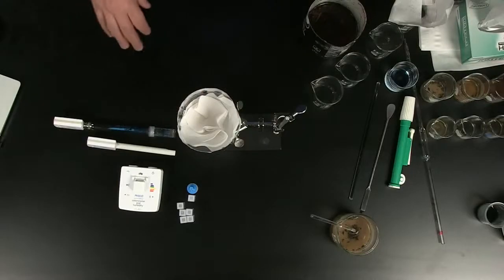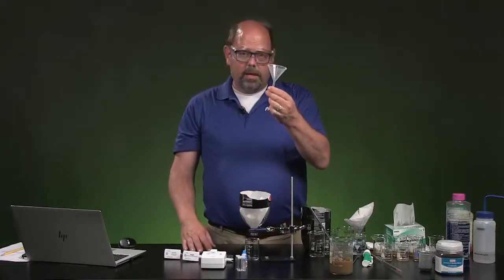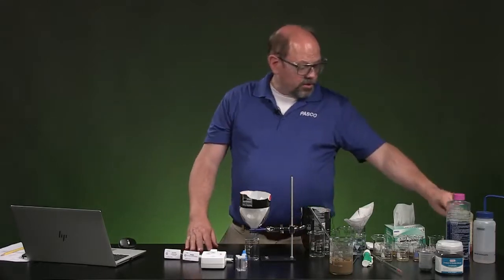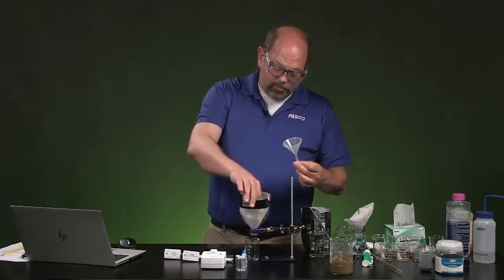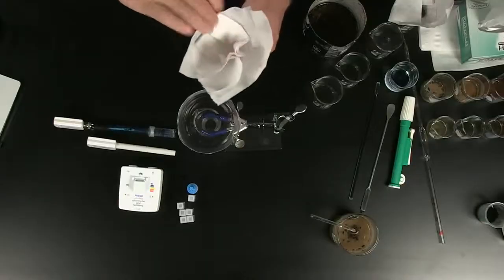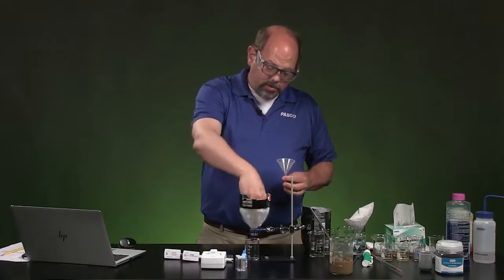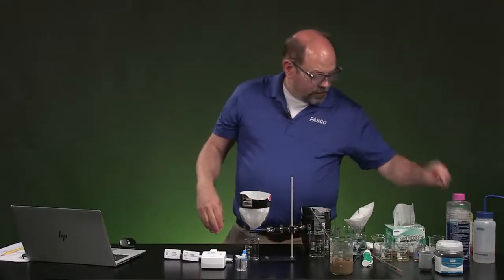Now, like I said, if you didn't make these, you may be given just a standard filter from your teacher, and you can put those inside as well. They'll be a little bigger than that, so you've got to make sure you push them down in there to dump your water in. So either one will be great. This is the one I'm going to use because that way you can go through more water if you need to.